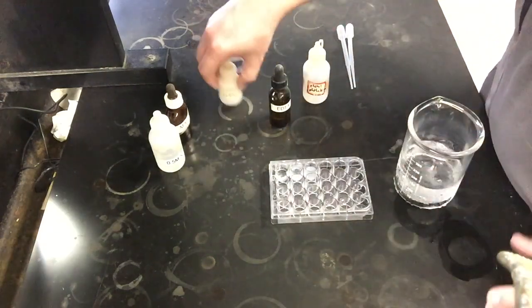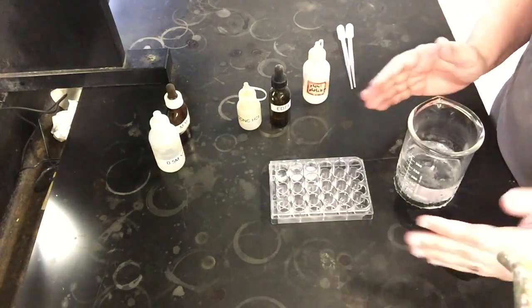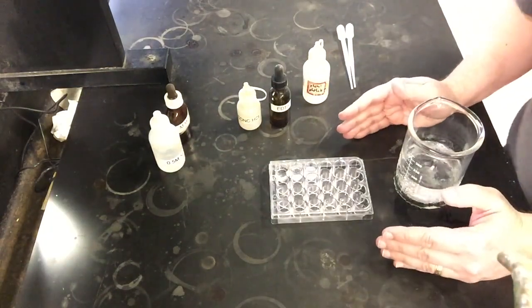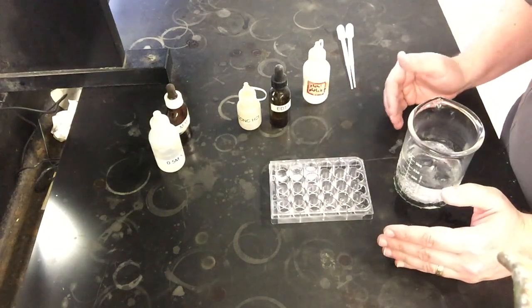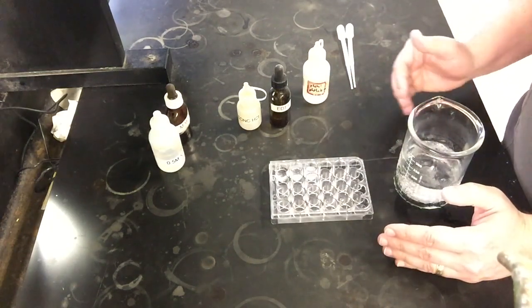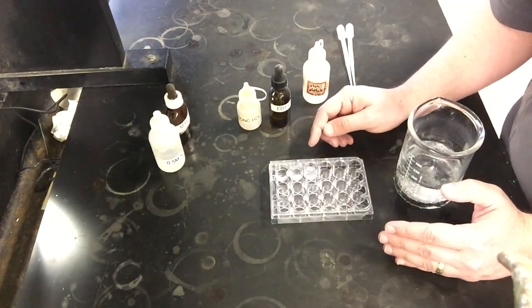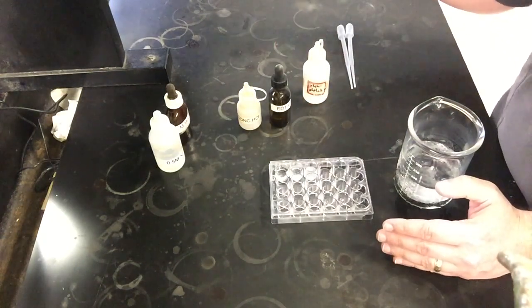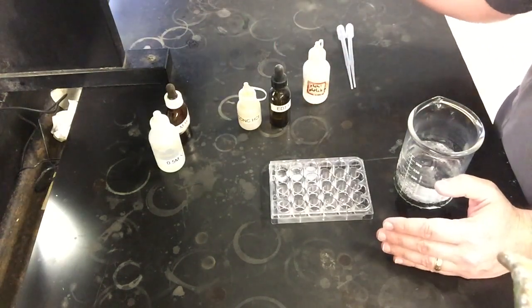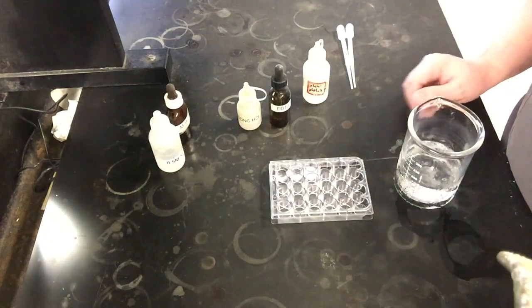Both HCl and EDTA have a similar effect in that the white solid is going away. And if we think about what that means for our equilibrium, if our equilibrium was magnesium hydroxide as a solid going to magnesium and hydroxide ions, that white stuff that we see is the initial reactant, right, the magnesium hydroxide. So if it's going away, adding these things does make us go towards products, but you want to think about why that is. I'm going to leave the explanation part to you guys as you go through your lab.